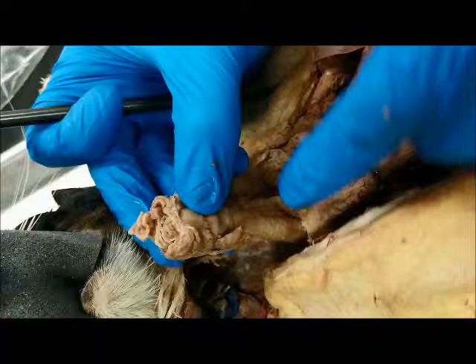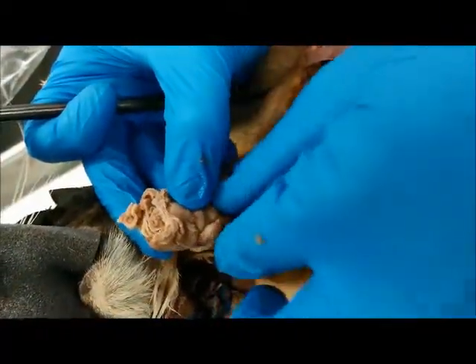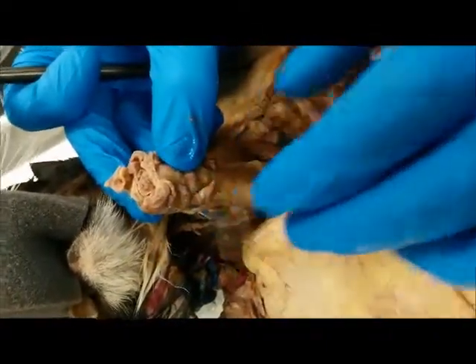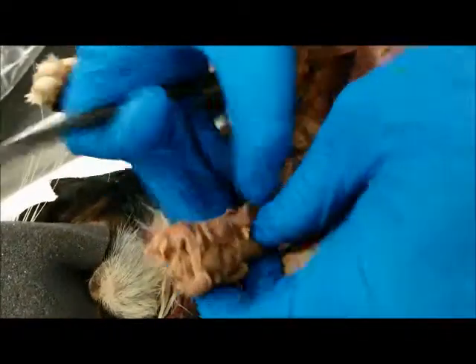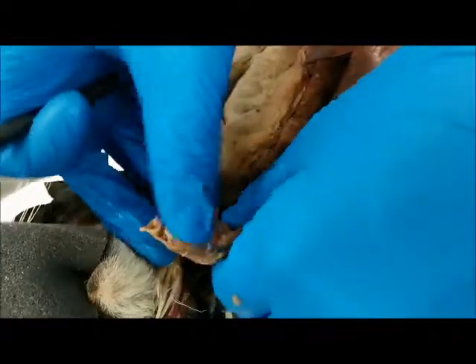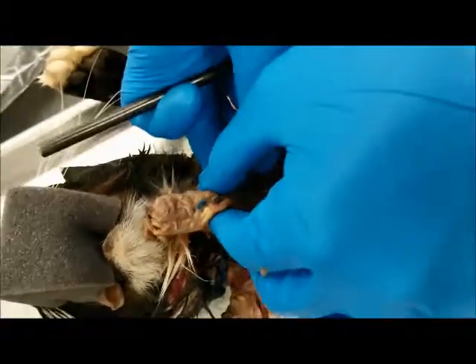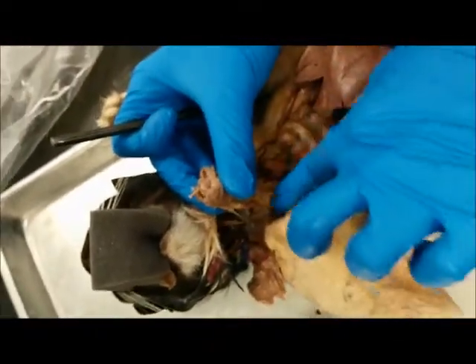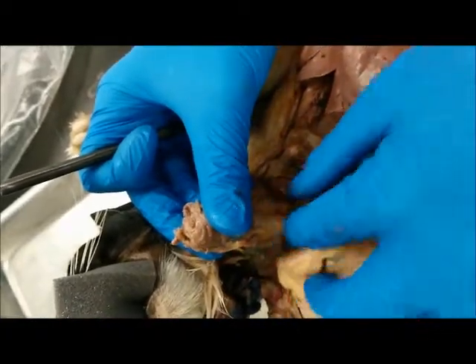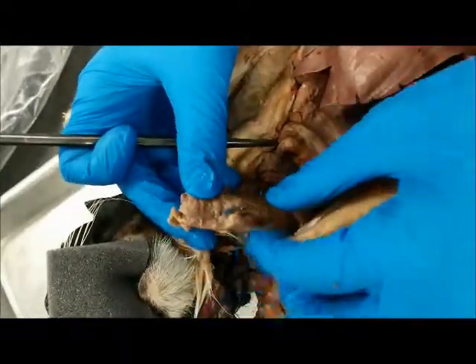The C shape consists of cartilage, and that allows the air tract to stay open in the trachea, and it also allows it to stay open when the esophagus right here expands. So again, the trachea is here, and the esophagus is posterior to, or dorsal to, the trachea. It's behind it, and the C shape serves to make sure the air tract, the trachea, is open and that it doesn't close.